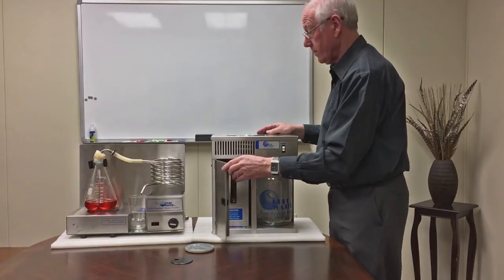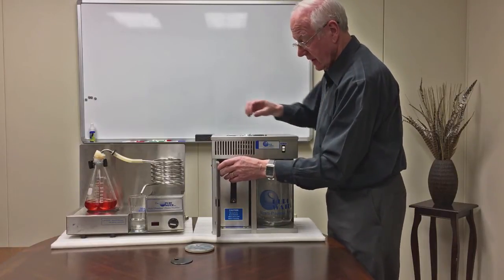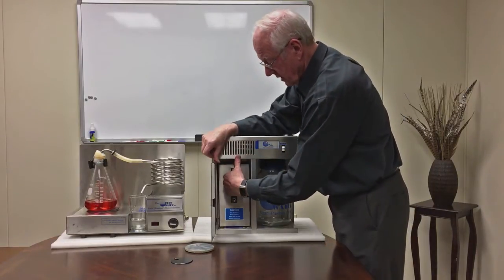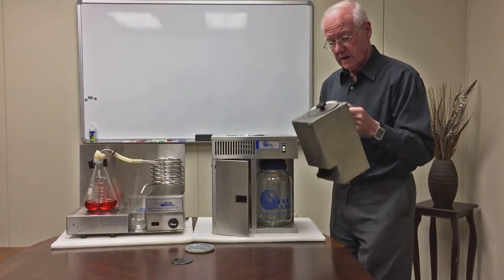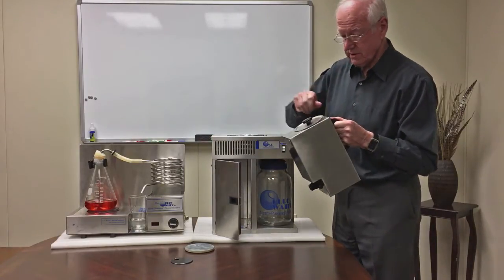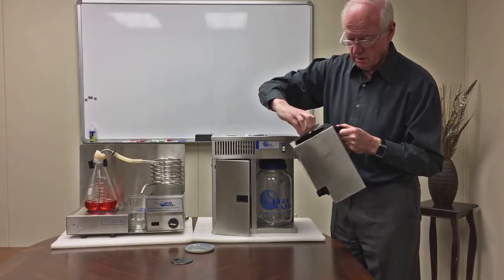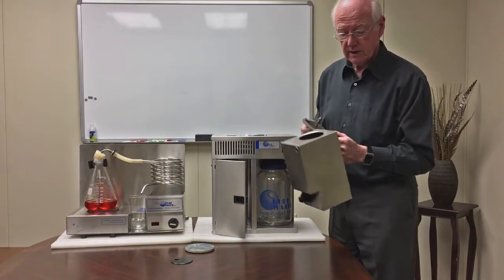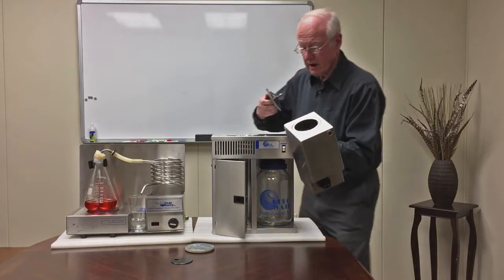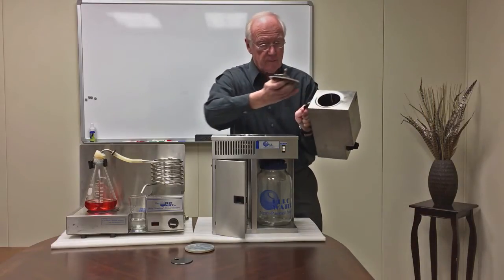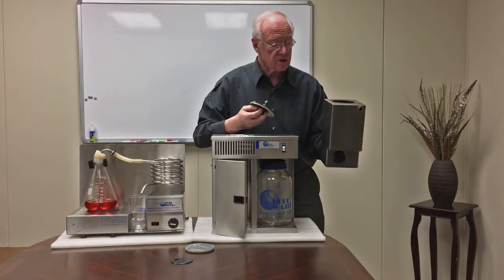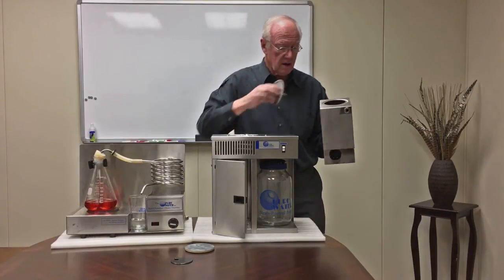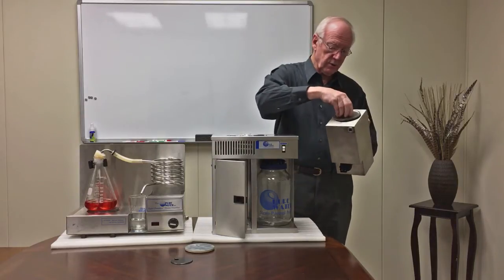It does not require waterline hookup. All it requires is an electrical outlet. What we do is we have a tank which is equivalent to this here. We remove the lid and we go over to the sink and fill it up until we fill it up to the bottom of that screw there.